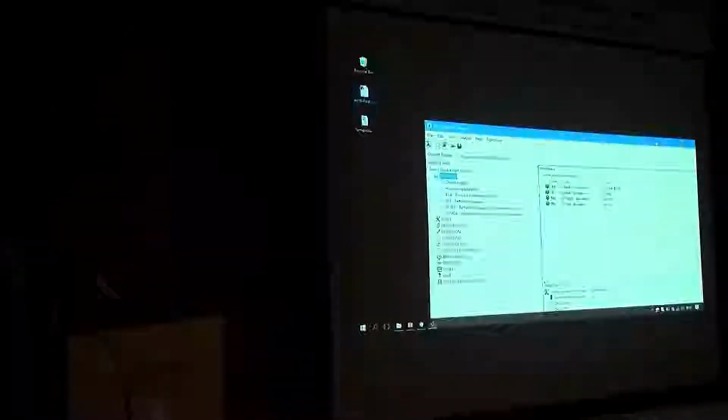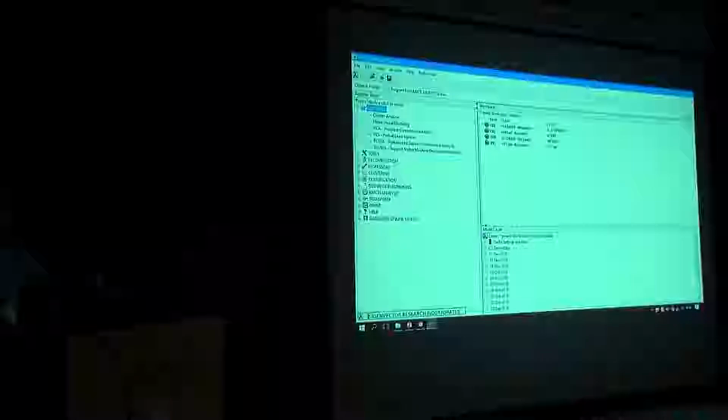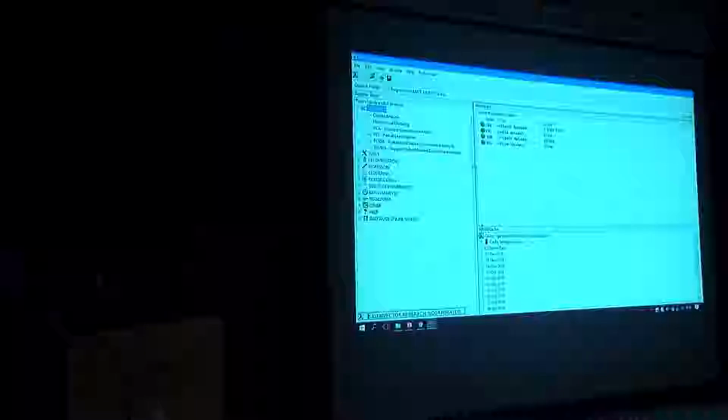So this Solo is a program that you install? Yes. There's a link in the abstract that I've submitted, and you have a 30-day free subscription to install and play with it, and after that you have to pay. But compared to many other software, price-wise, it's reasonably priced. What is the range of the price? I think it's out of the remit of this discussion, because I'm not representing them really. I think it's a useful software to deal with this type of data. But you can use R, you can use Python. All of these have equivalents in those other programming languages. So, is that clear enough?